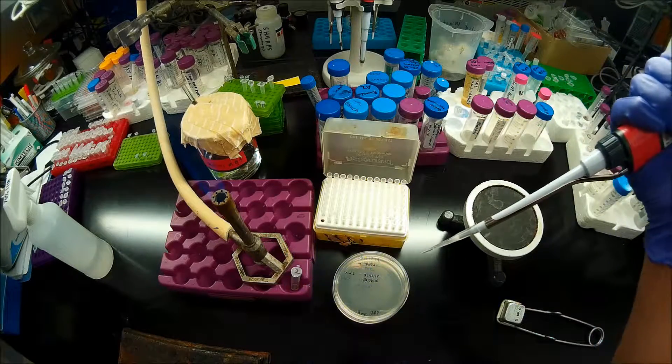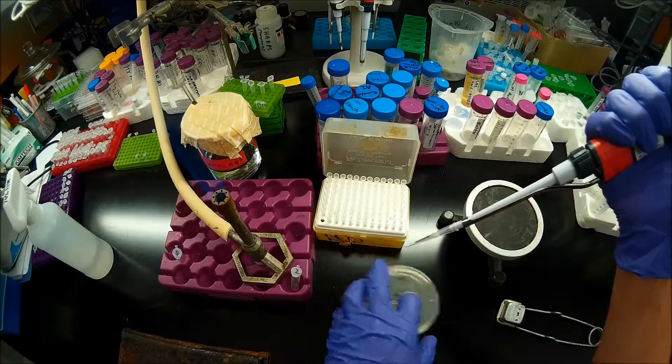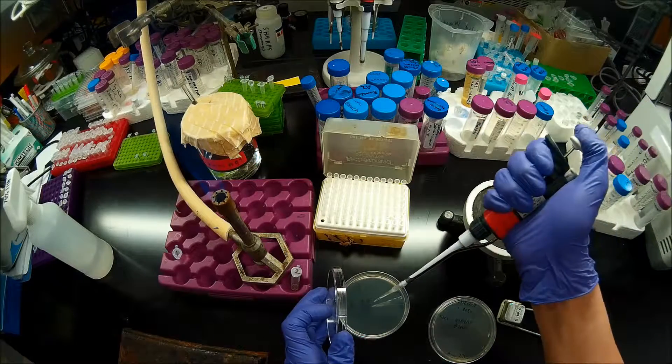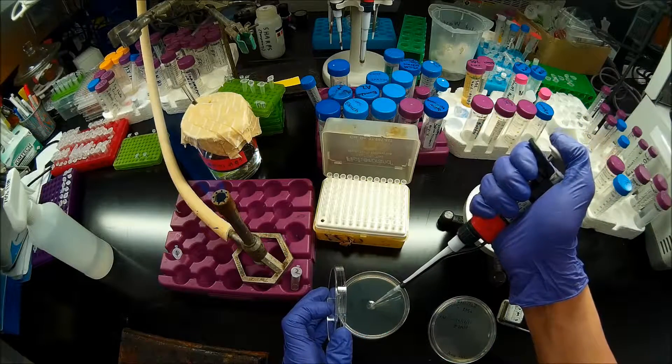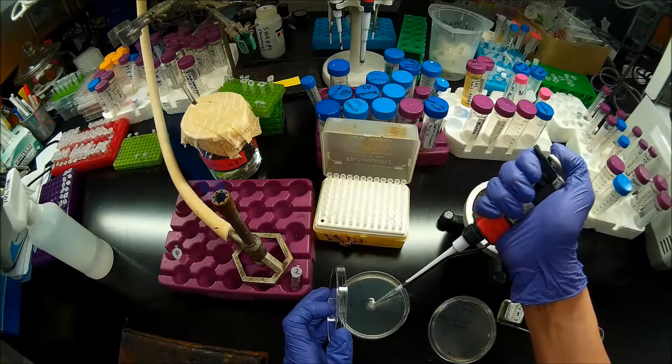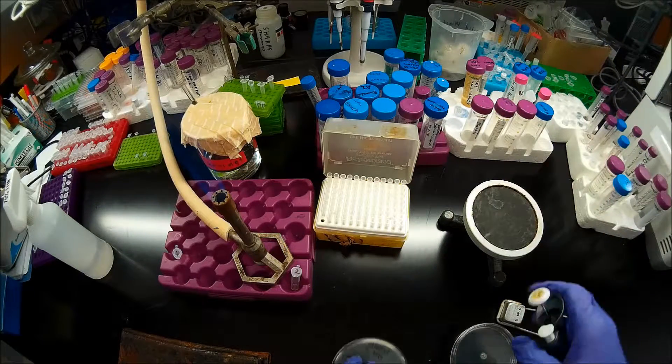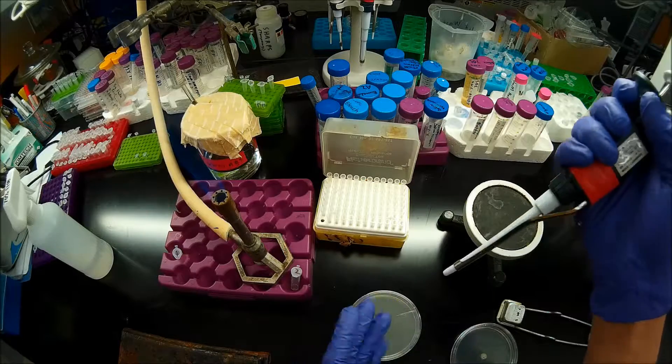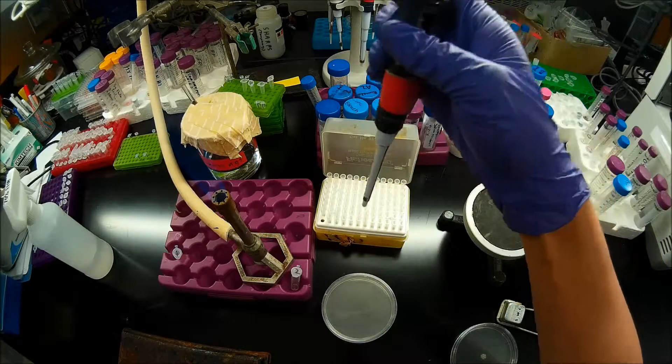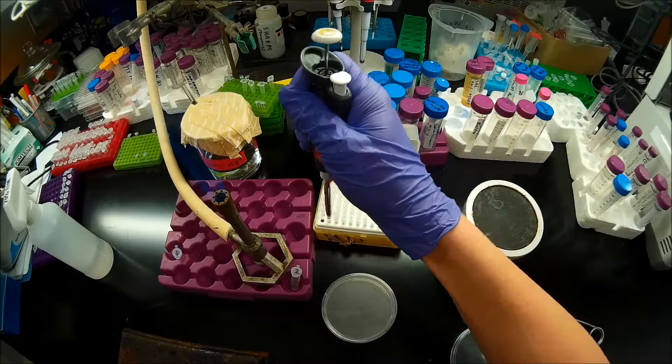Now I'm going to dispense that entire thing to my plate. Again, because I'm transforming with a ligation mixture, so I expect my transformation efficiency to be considerably lower. If I were transforming a whole plasmid, I might only take a portion of that. Or I might not have even spun them down. I might have just taken 100 microliters of the total mixture.